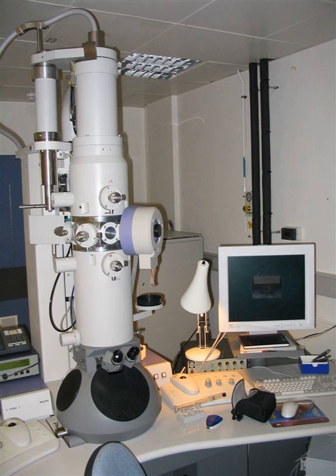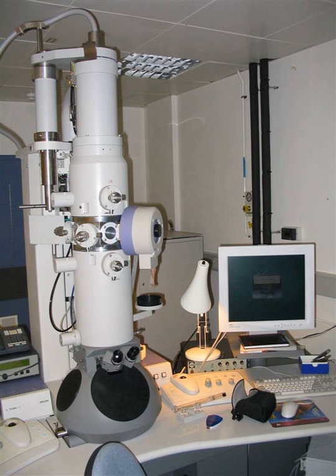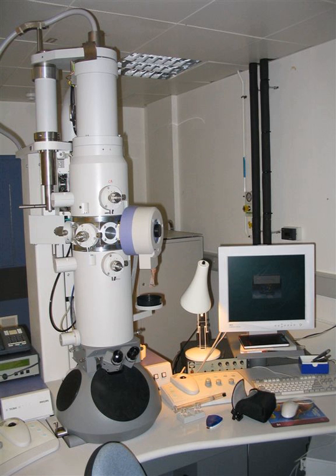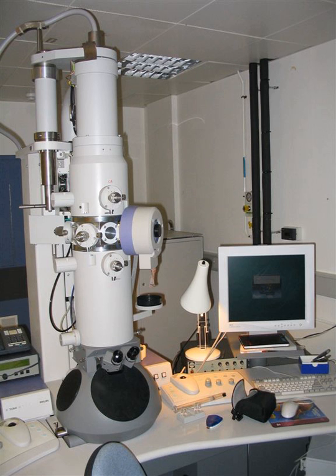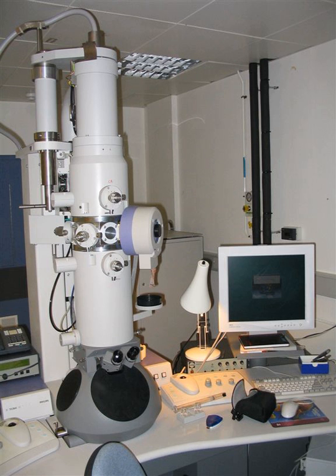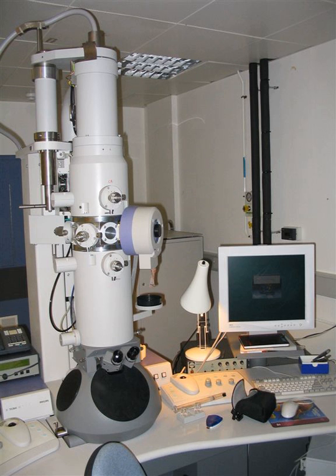Electron microscopes have electron optical lens systems that are analogous to the glass lenses of an optical light microscope. They are used to investigate the ultrastructure of a wide range of biological and inorganic specimens including microorganisms, cells, large molecules, biopsy samples, metals, and crystals. Industrially, electron microscopes are often used for quality control and failure analysis. Modern electron microscopes produce electron micrographs using specialized digital cameras and frame grabbers to capture the images.